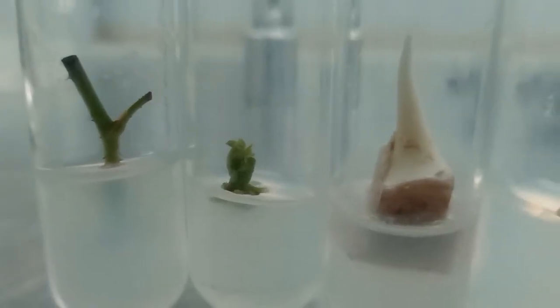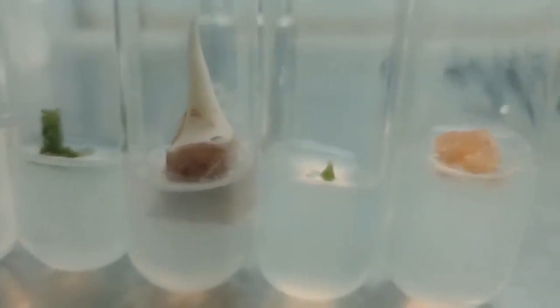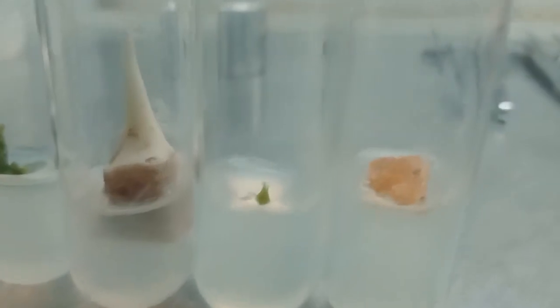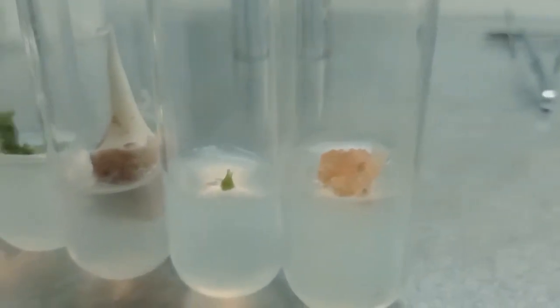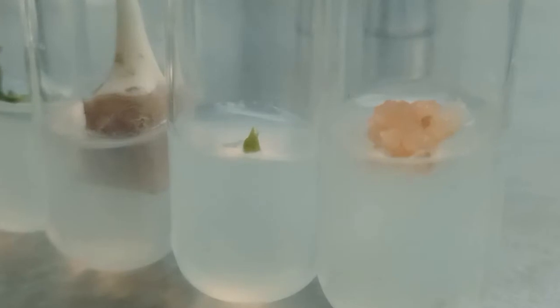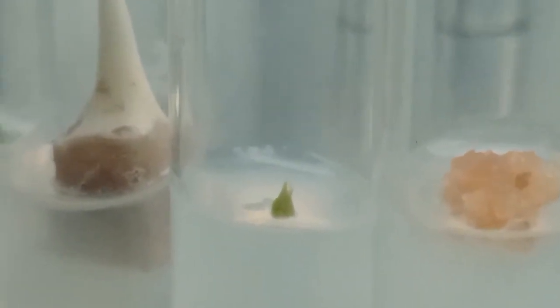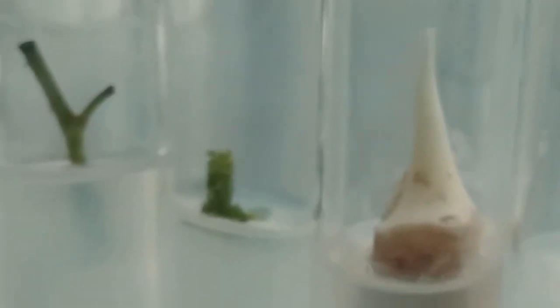Dear students, you can see in the video: cassava, banana, rose, and callus cultures. You can see meristem tip culture of cassava, shoot tip culture of banana, shoot tip culture of cassava, and shoot tip culture of rose.